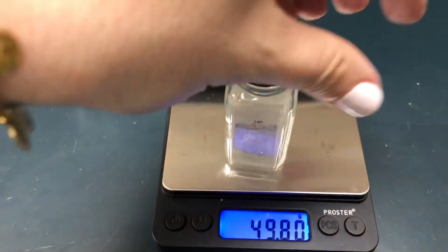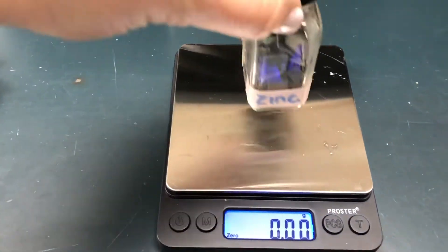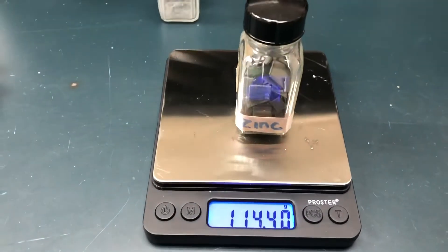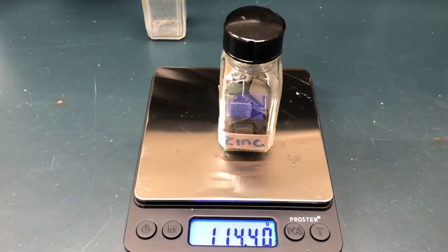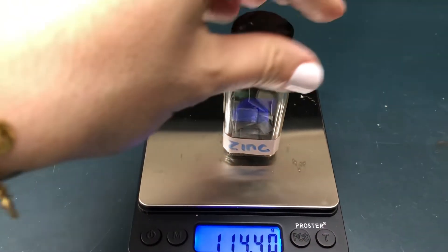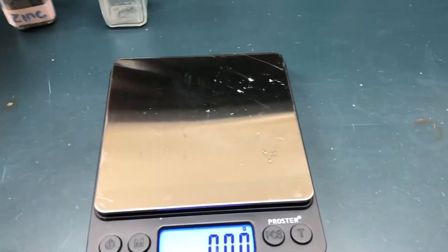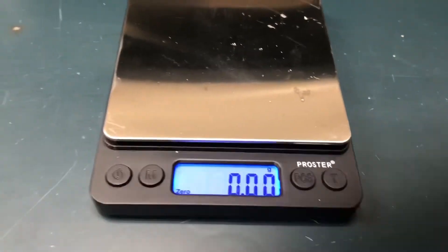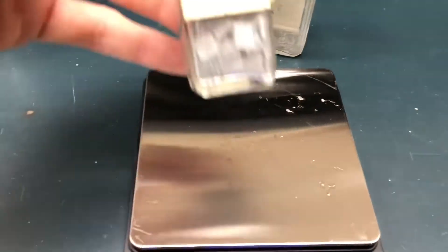And then now my zinc sample with the bottle and the cap. Again, think about what you need to do in order to just get the mass of the zinc sample. My next station is a similar concept, but instead of zinc I have lead.